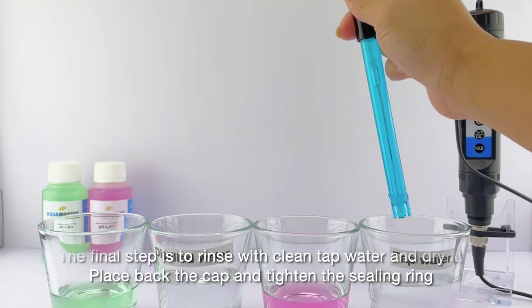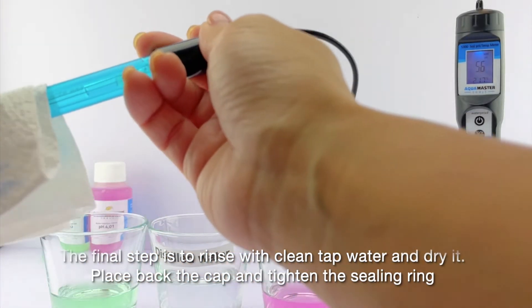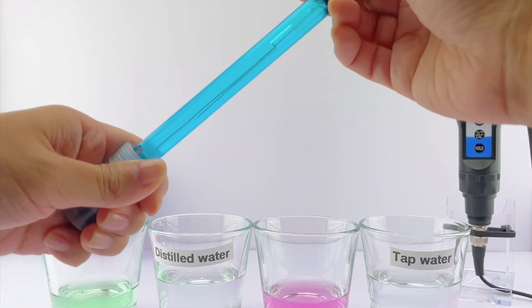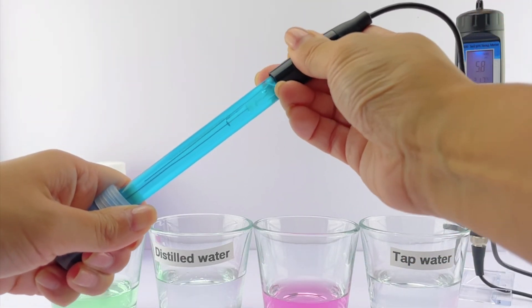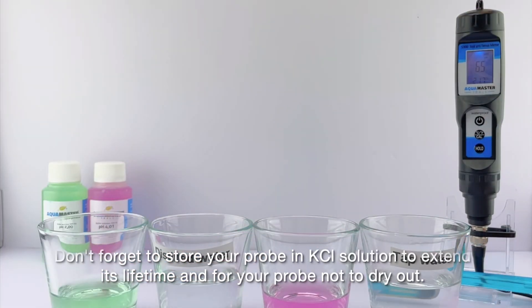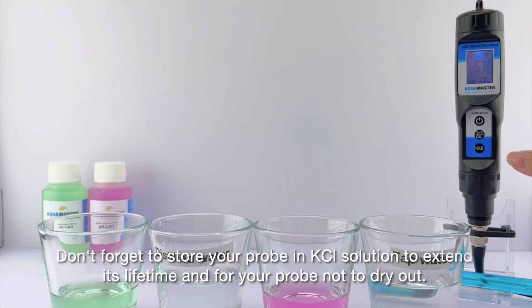The final step is to rinse with clean tap water and dry it. Place back the cap and tighten the sealing ring. Don't forget to store your probe in KCL solution to extend its lifetime and prevent your probe from drying out.